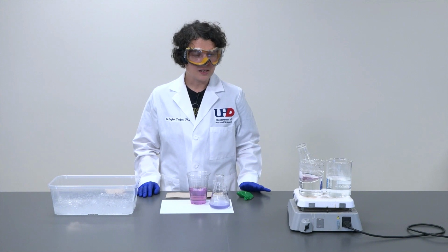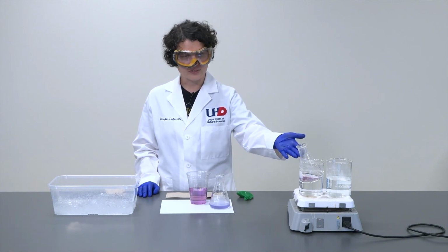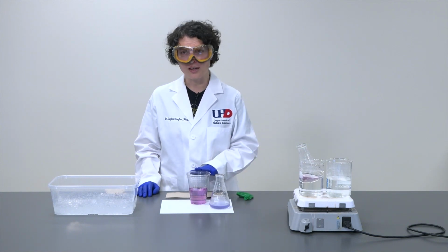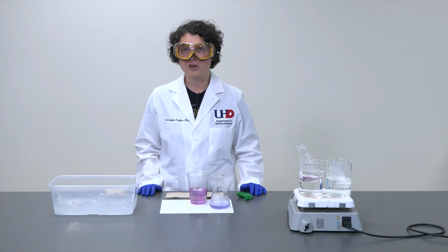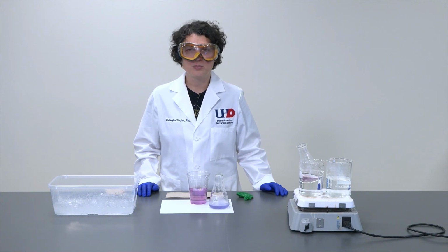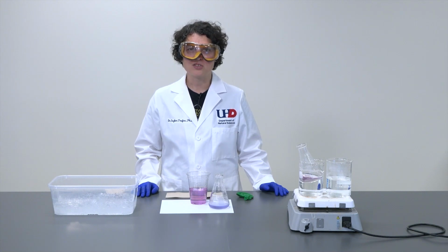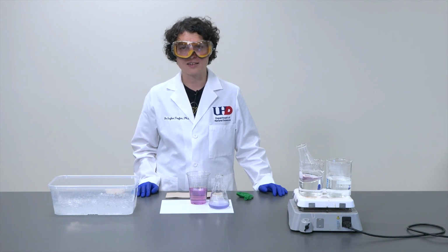In the meantime, if it is true that the availability of carbon dioxide caused our balloon-connected Erlenmeyer flask to maintain its color a lot closer to this pinkish range, then with the addition of more carbon dioxide, we should be able to turn our solution to the same color. And one way to add carbon dioxide to it would be to find some dry ice and add it in, or absent dry ice, we can always use the natural biology of human beings where we breathe in more oxygen and we breathe out more carbon dioxide.